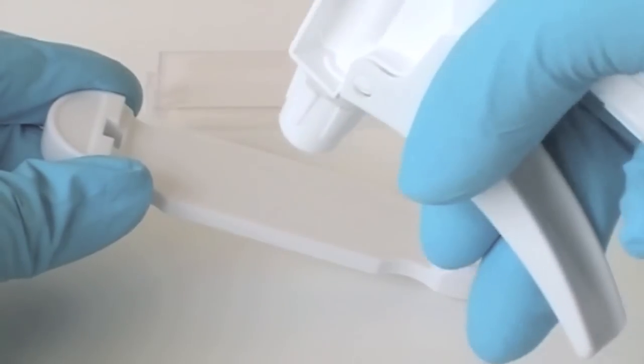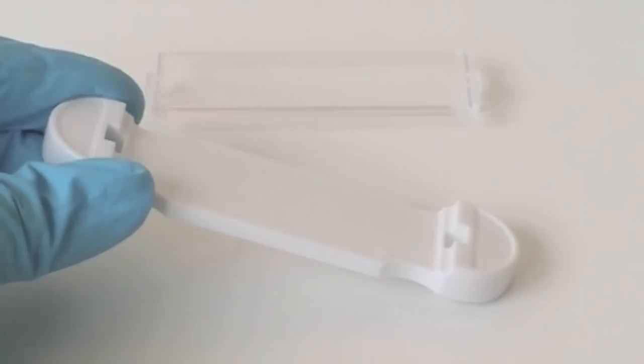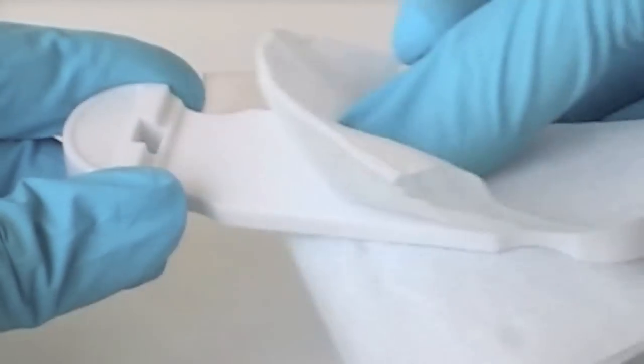First, spray the caster with ethanol. Make sure you wipe it well. We also recommend you soak it in alcohol for 15 minutes and allow to dry in the hood.